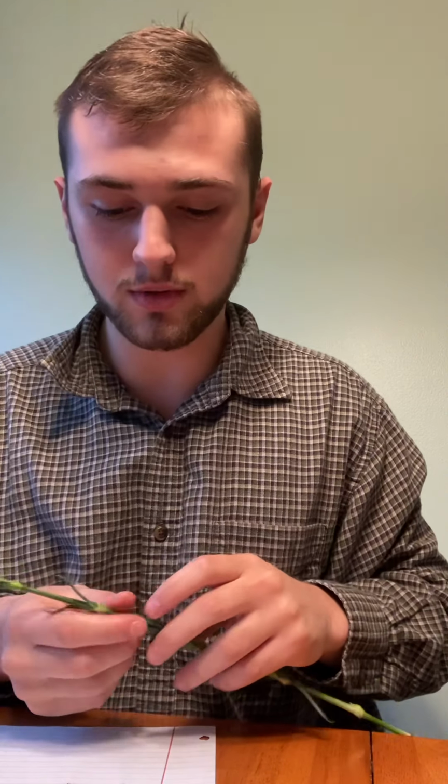Right here we have the sepals. And they are right here. Right in there. And the sepals, I keep on getting phone calls. Sorry about that. And the goal of the sepals is to still cover the flower. As you can see, this one isn't fully bloomed, so it's still covering part of it.